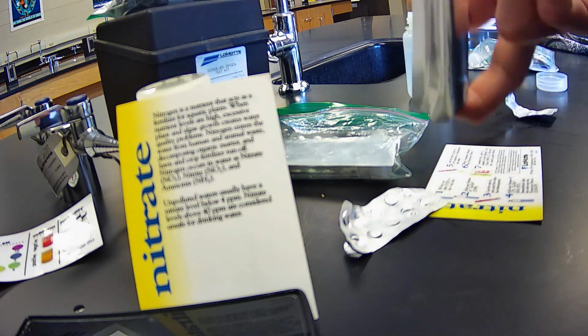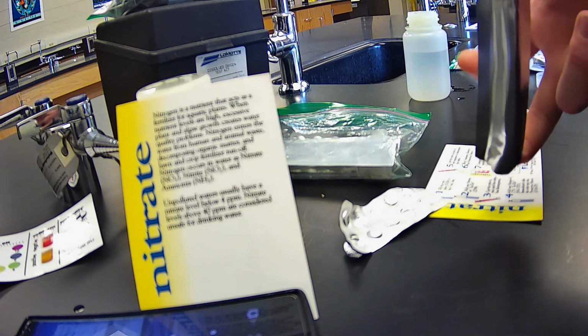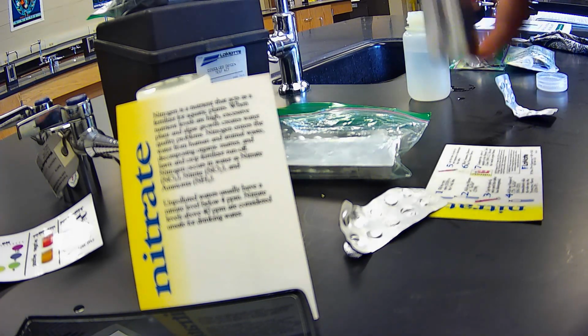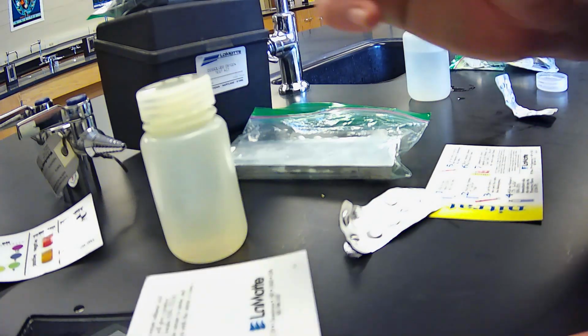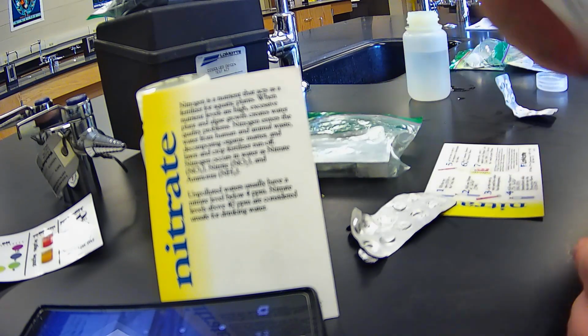So we would really like for this sample, hopefully, if it's unpolluted, to be below 4 ppm. But note that this video was taken in November, November the 10th. We are in East Tennessee, right? So deciduous forest, there was quite a bit of leaf litter present at our test site. And if we look at the time here, it's been about 2 minutes. So we're going to let the nitrate sit and wait for a whole 5 minutes.